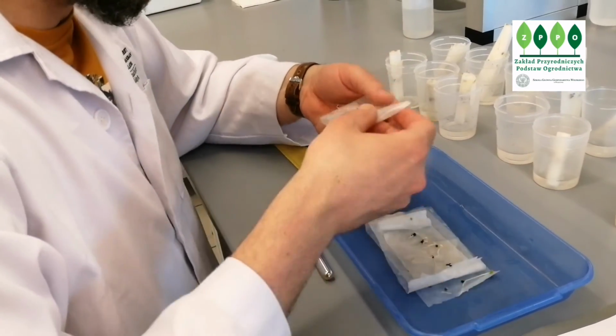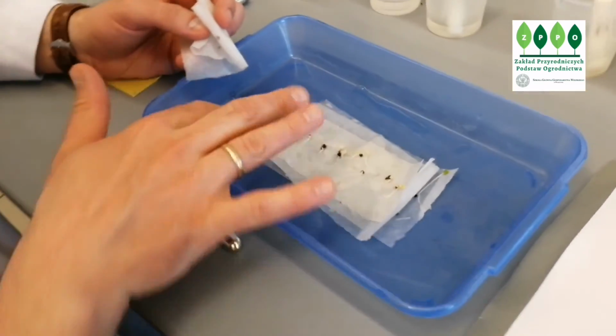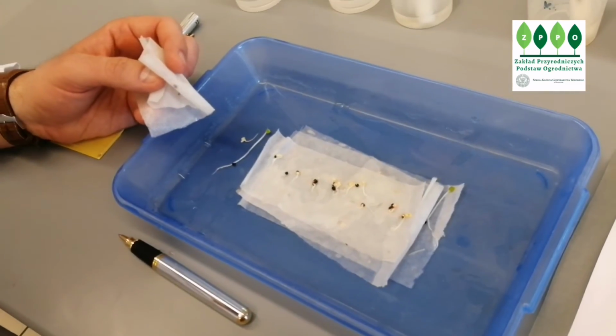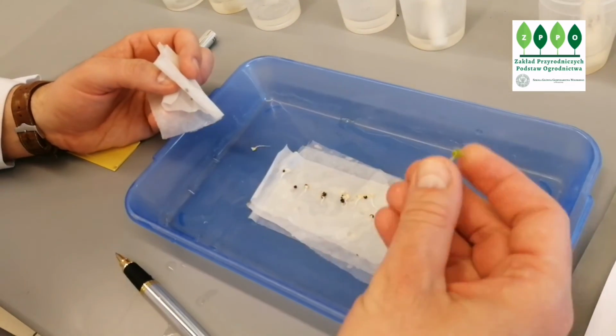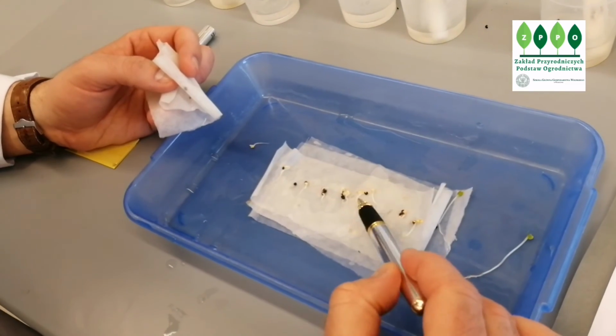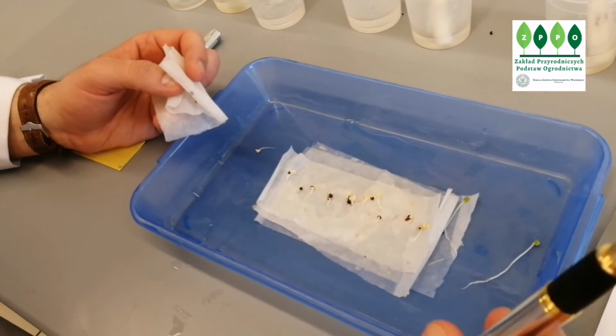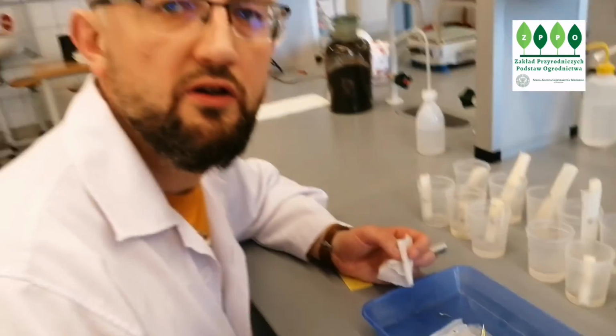Even if this is the second highest concentration of salt, all of them germinated, as you can see. The difference is that we do not see such big seedlings as we saw in control. Most of them have roots and very short hypocotyl, which is still not developed. I think we don't need to show more. It's enough. So we will do calculation.